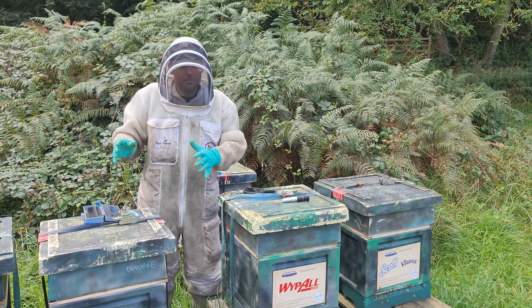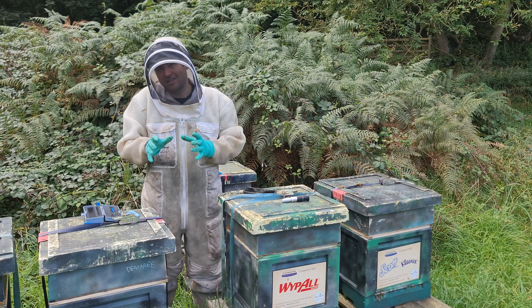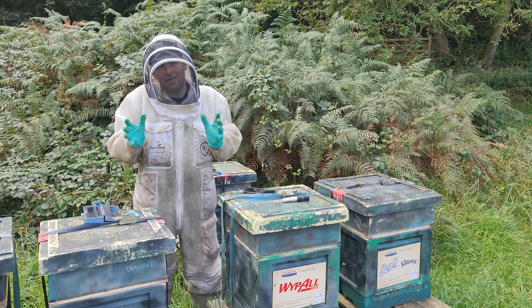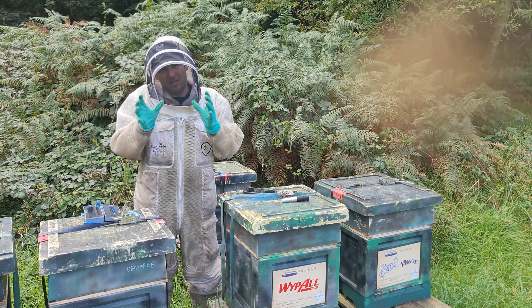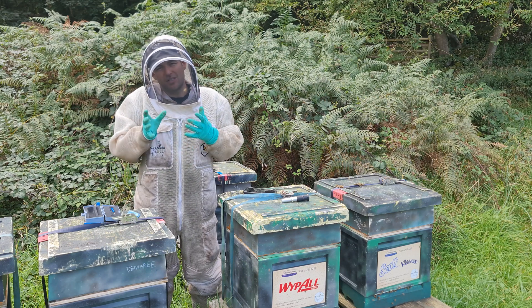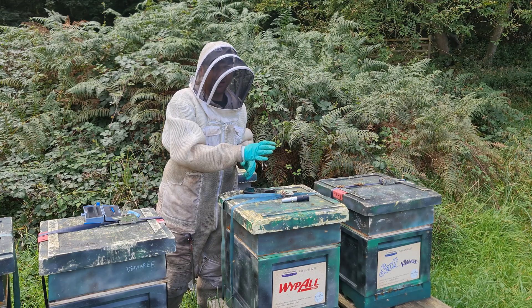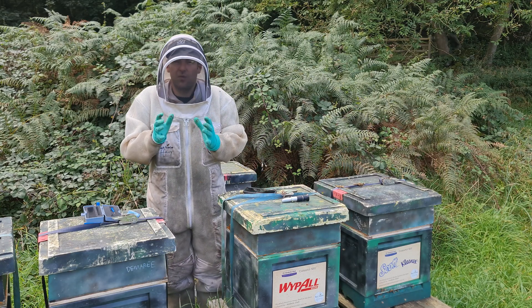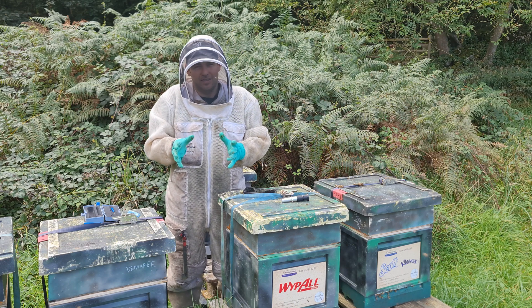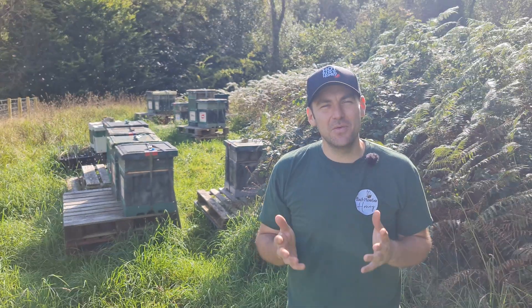So there you go — simple as that. The bees didn't mind too much. I've taken the honey from the hives and they've given us the readings to show us that, this late in the year, the moisture content is very, very low indeed. Struggling to find anything above 20%, and 20% seems to be the mark where it might ferment — it might not. But if you can go through your buckets and check everything coming out of your extractor, making sure it's under 20% and ideally around 17 or 18%, it will pay for itself 100 times over. And if you find yourself with buckets of honey that are too high, there are ways to reduce the moisture content with very little work indeed — I'll cover that in a separate video.